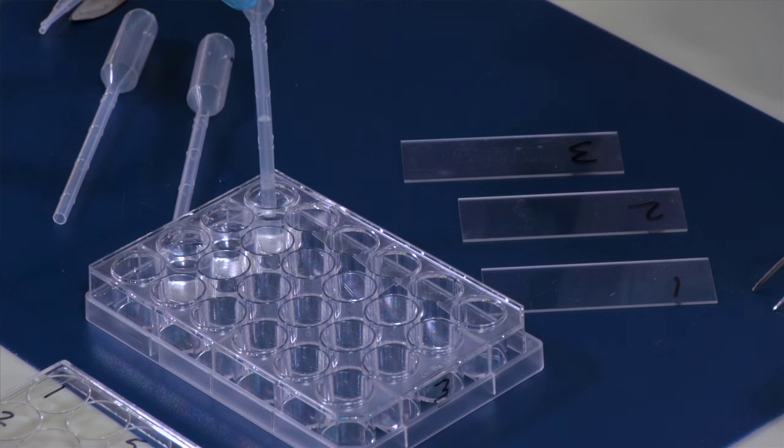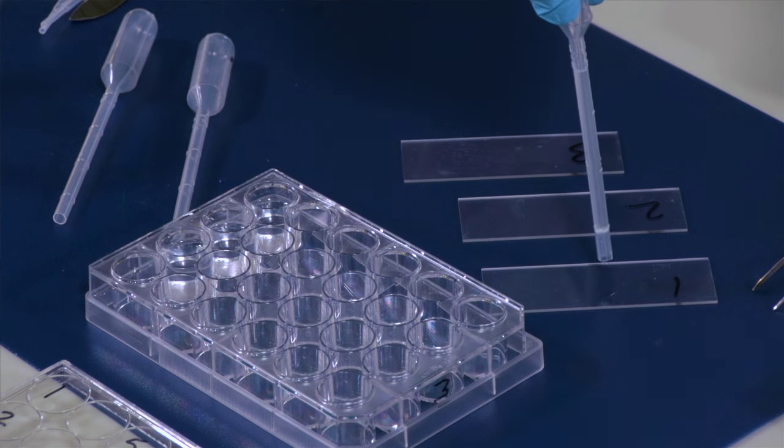And we just suction those up off the bottom and it's a good idea to hold the pipette still for a little bit, maybe 15 seconds, before you actually place these on the slide.